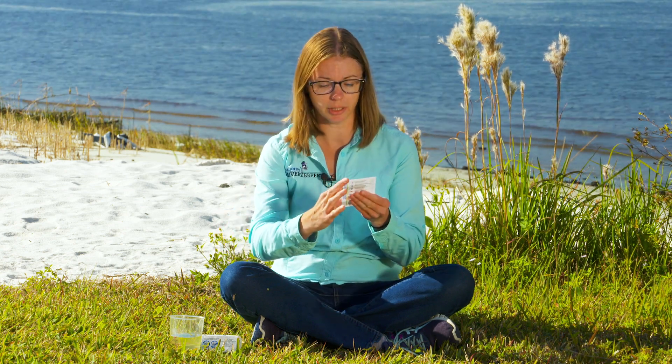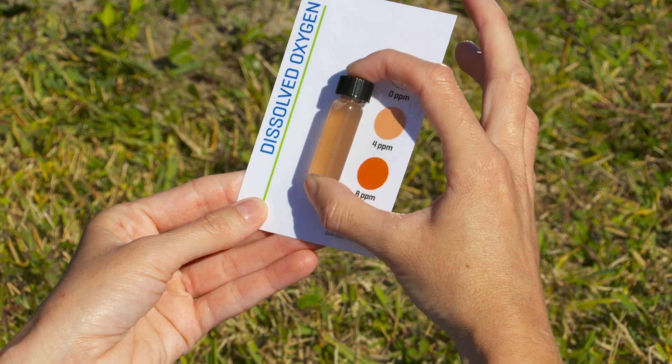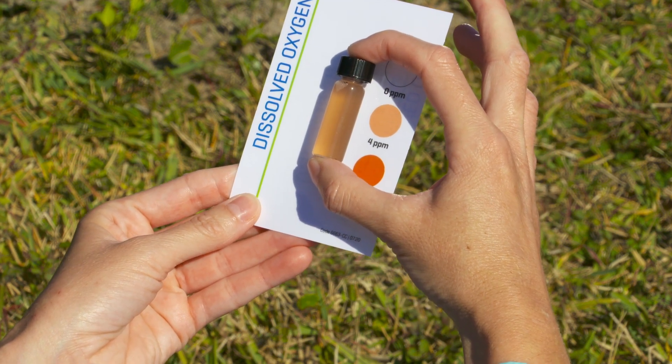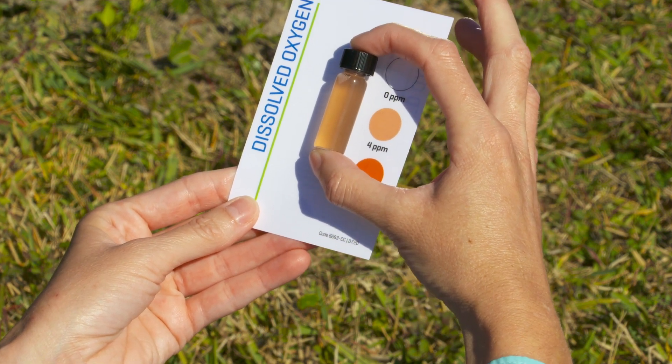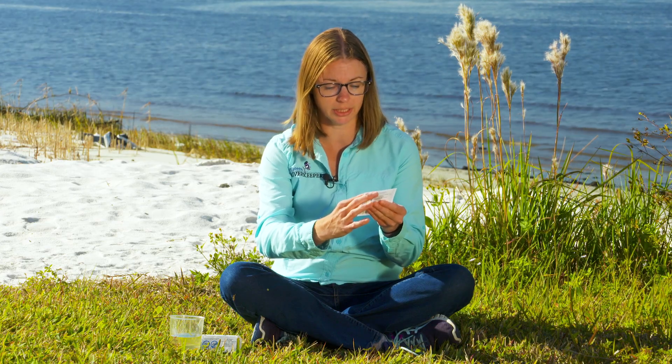We've waited until our test tablets dissolved, so now we're going to compare the color of our test tube to our color comparator and see what our results are for today. It looks like our dissolved oxygen levels are 4 or 5 ppm, which is good for a healthy biodiversity — but how can dissolved oxygen levels drop to harmful levels?